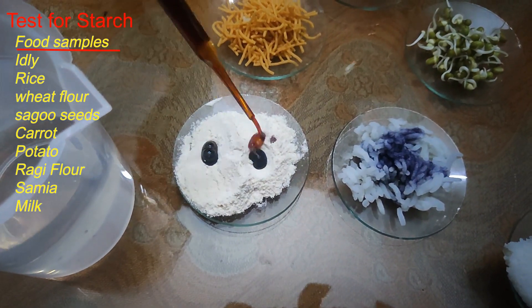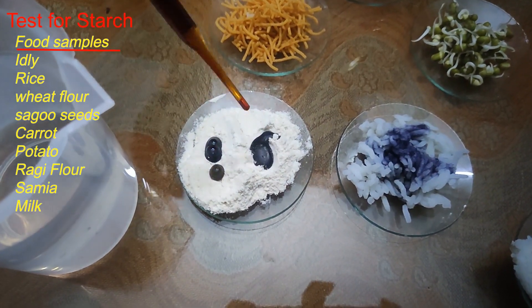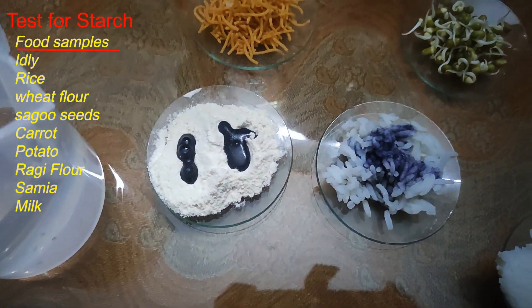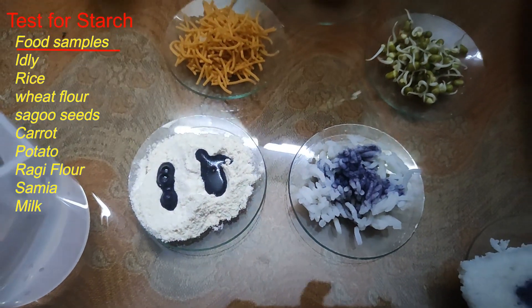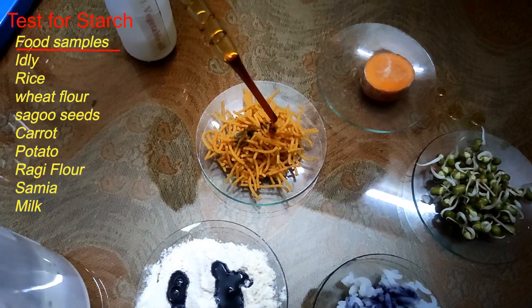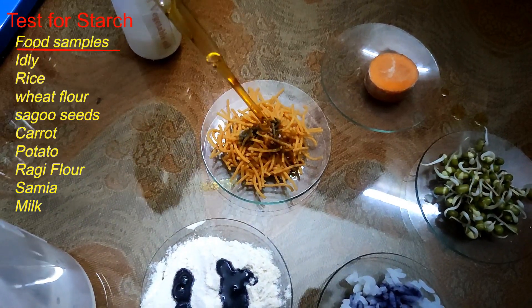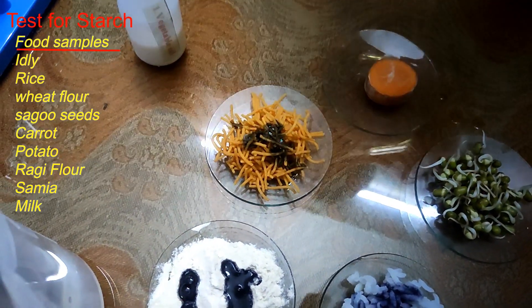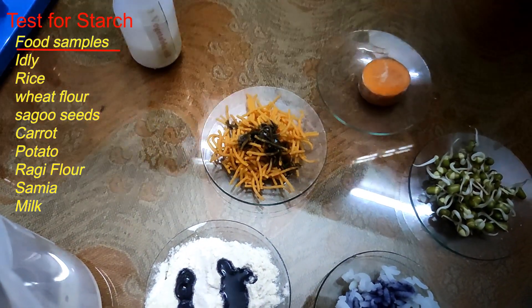Next is a snack item made with rice flour. I am adding iodine to that. It also changes to black color.